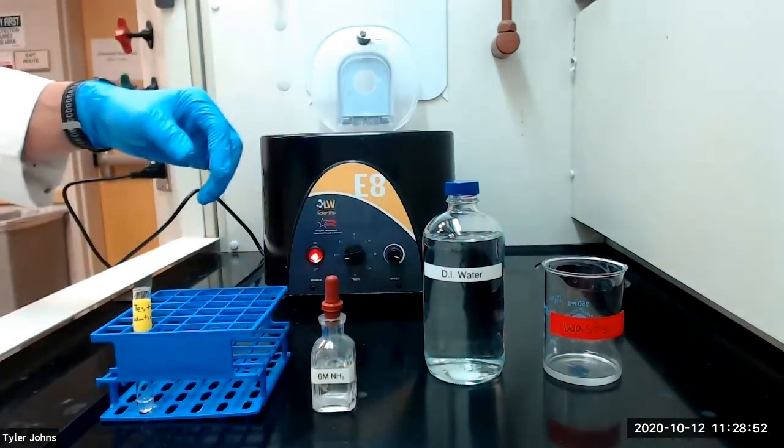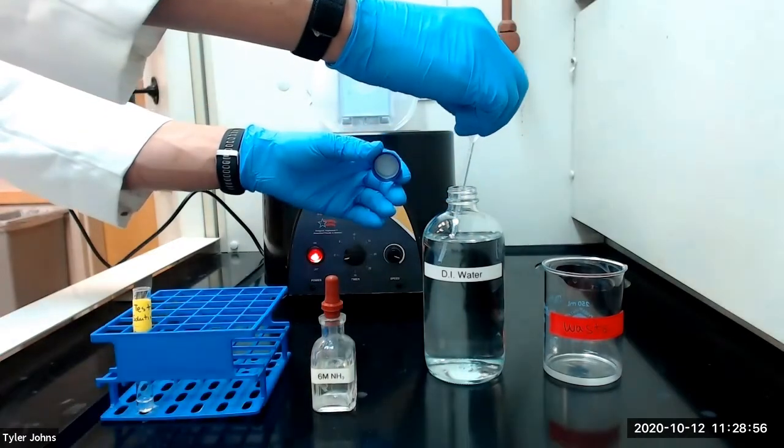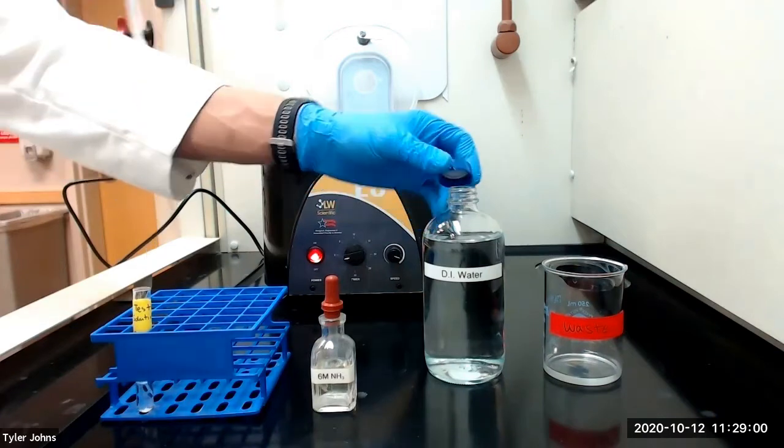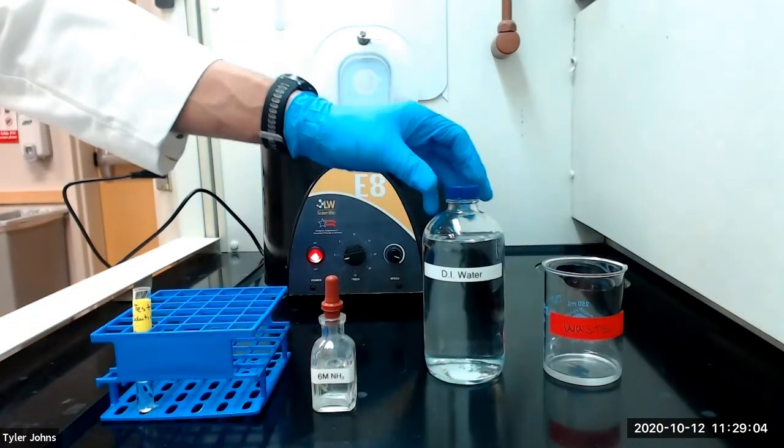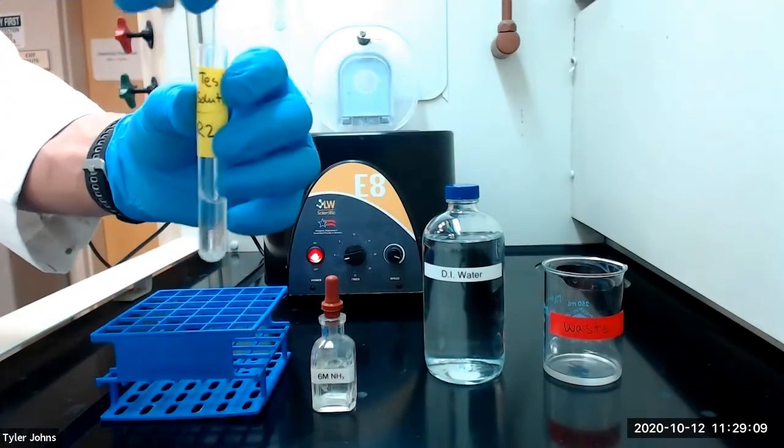We will also add two milliliters of deionized water. We will stir and then centrifuge.